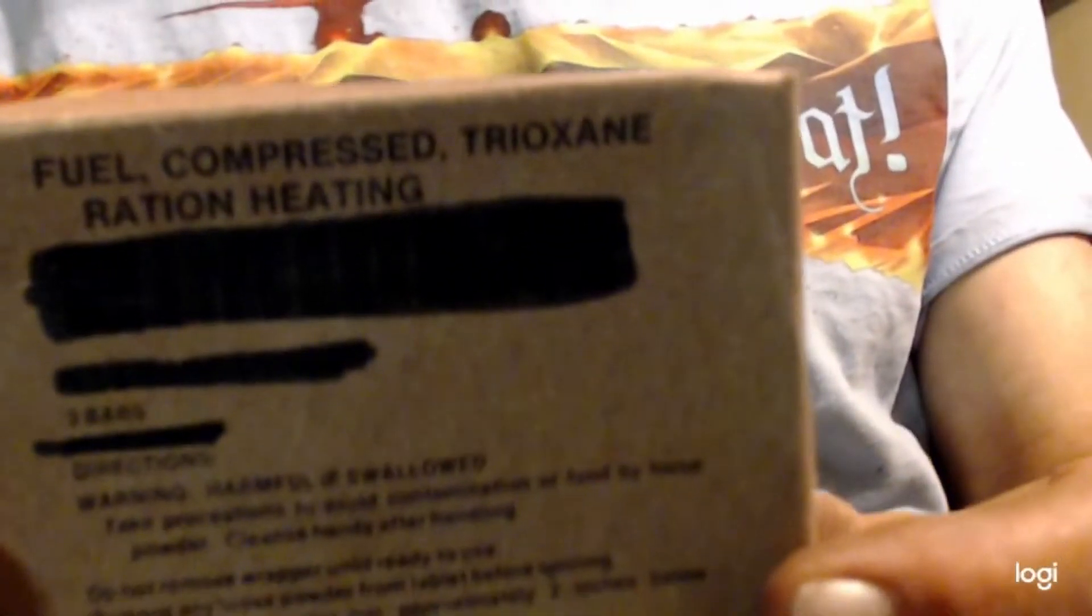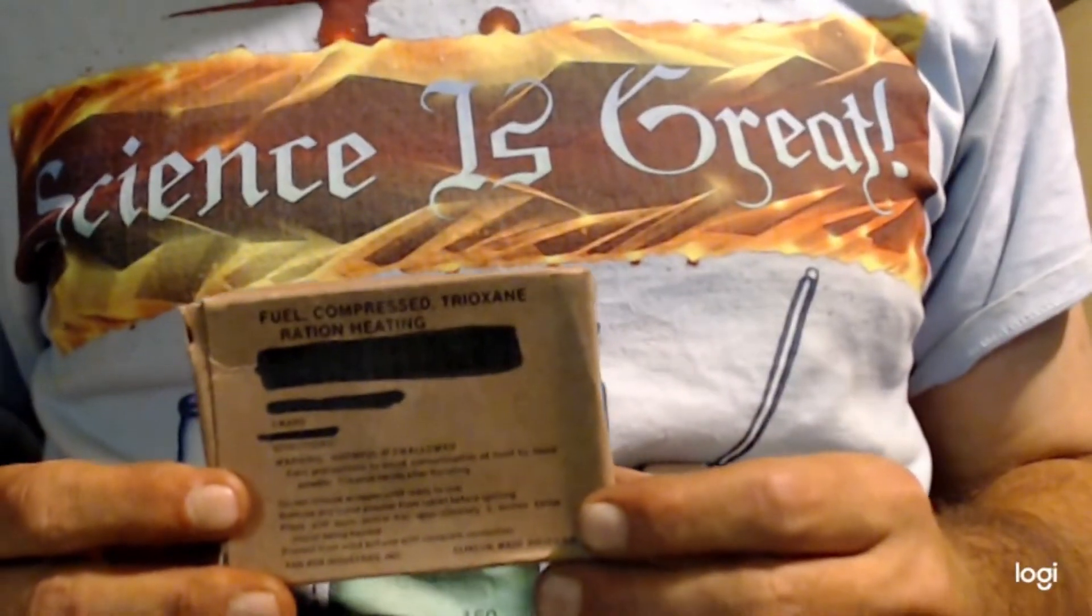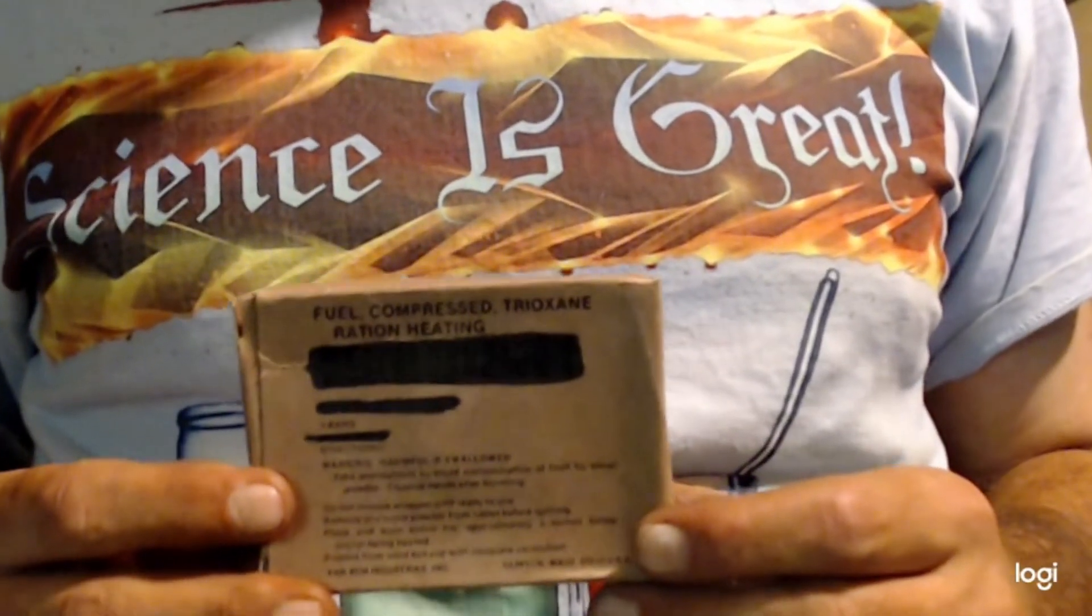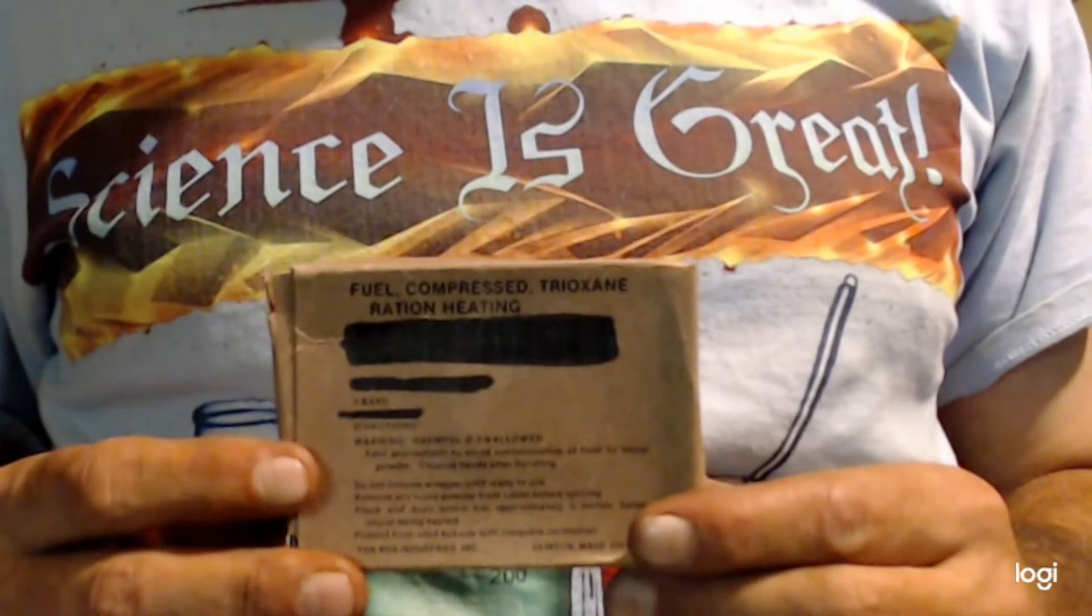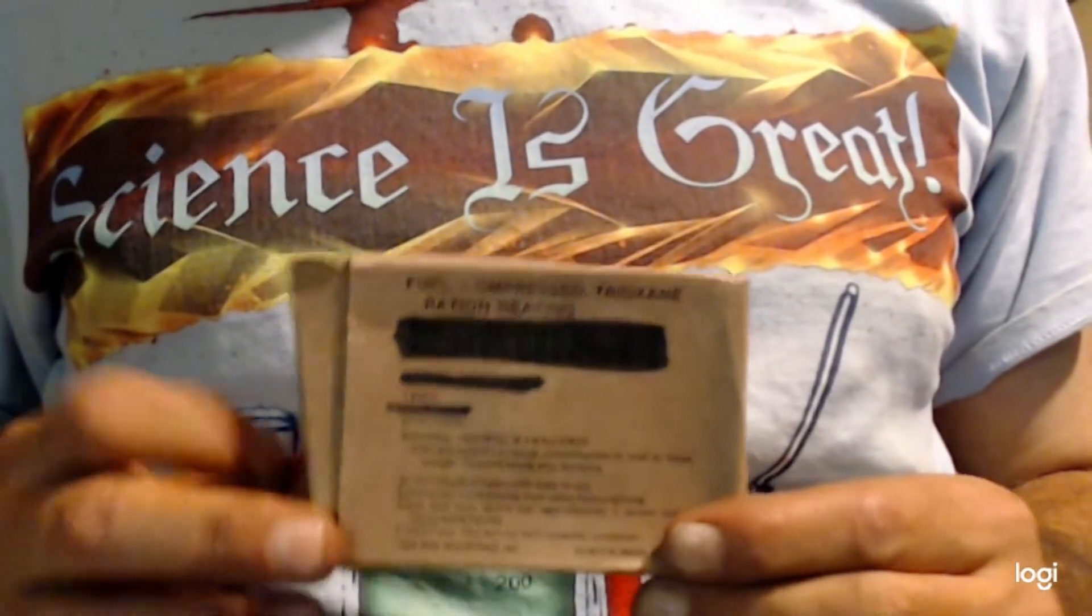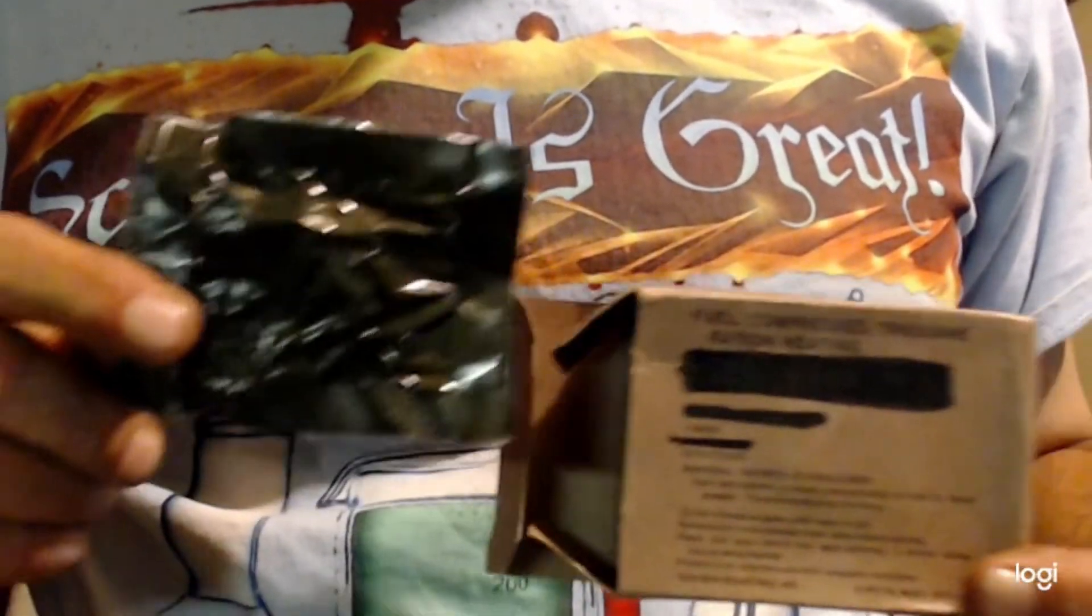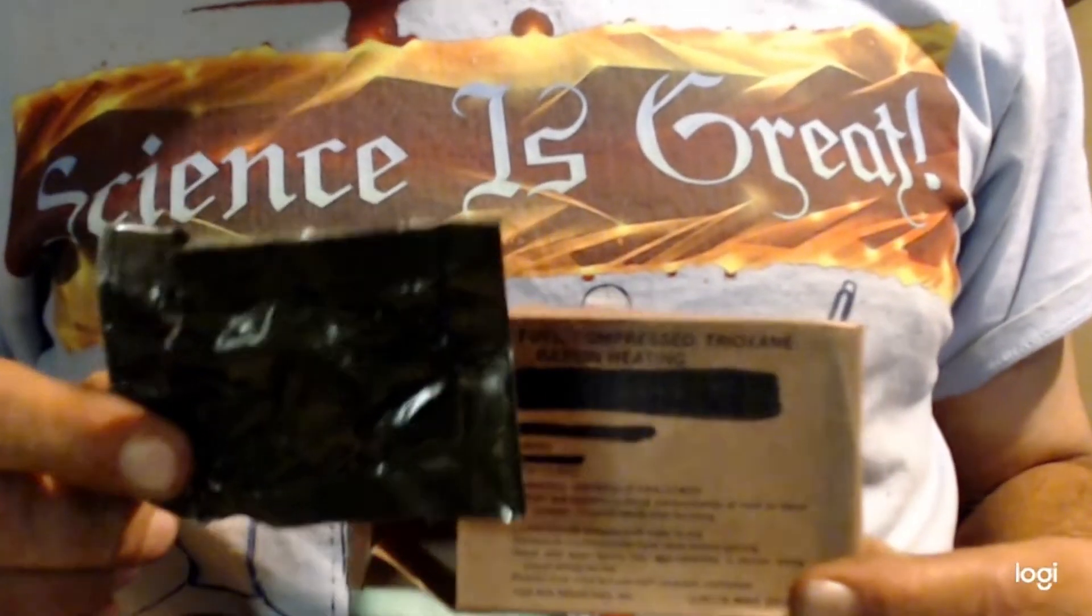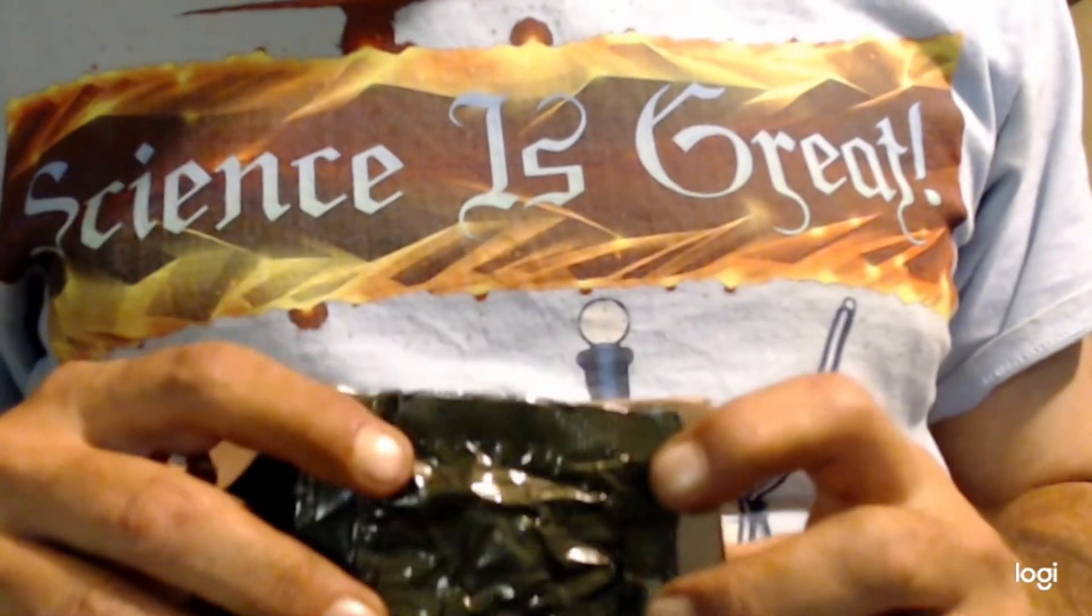This is a trioxane. It's used for outdoorsmen people, they go camping and stuff like that or in the military. It's a pure tablet. Each box usually comes with three tablets. They have different sized tablets. I think mine are the smallest tablets you can get.